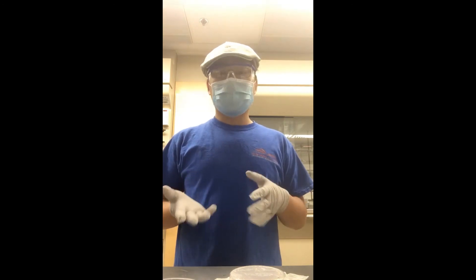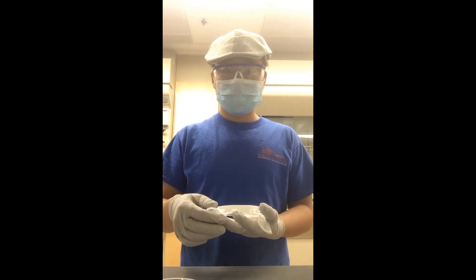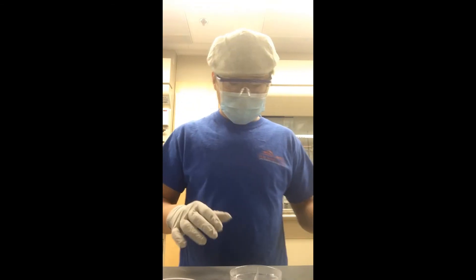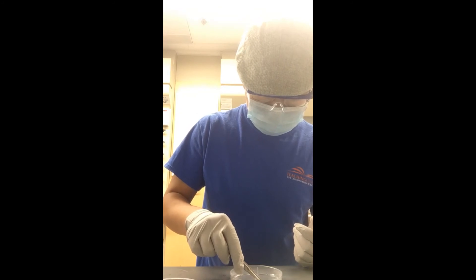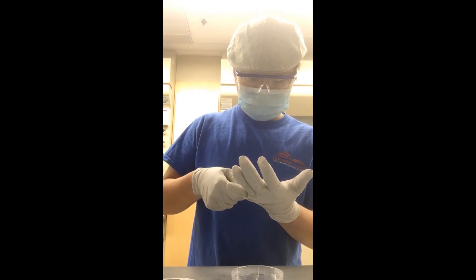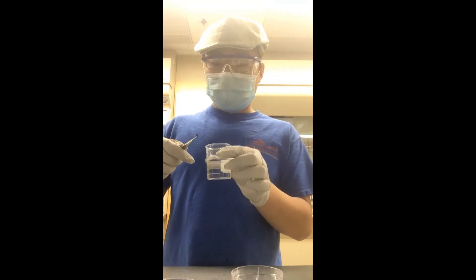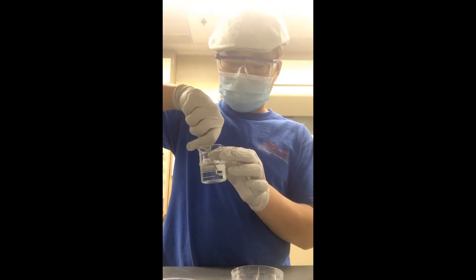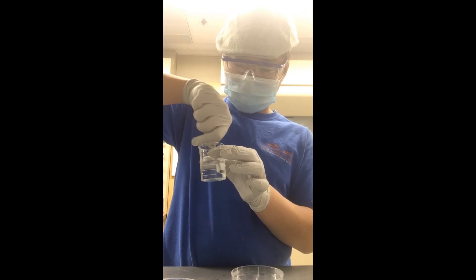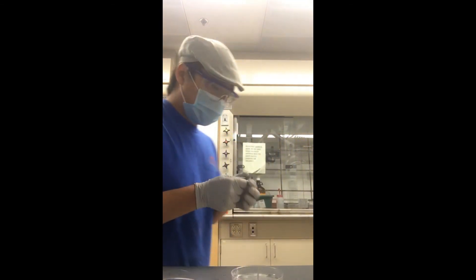The DNA has been sitting on the wafer for about 30 minutes. Now I'm going to carefully take it out and place the wafer in a solution of 90% ethanol and 10% water, and just swirl it around. Next I'm going to take it and dry it with nitrogen air.